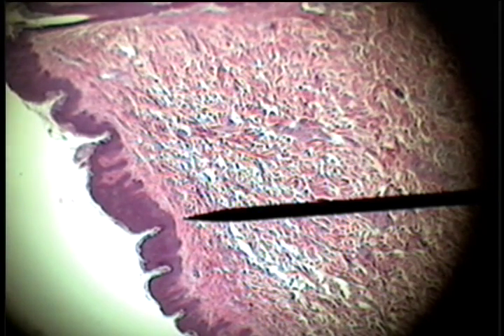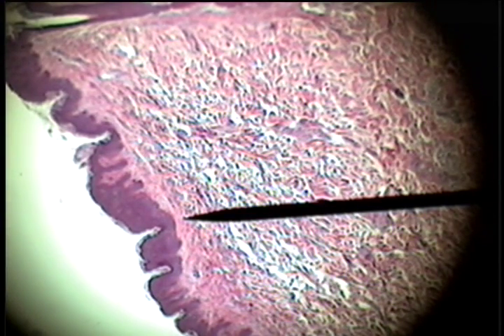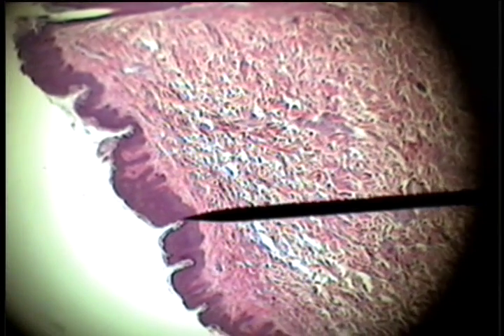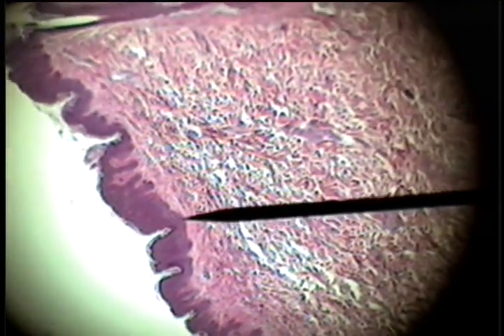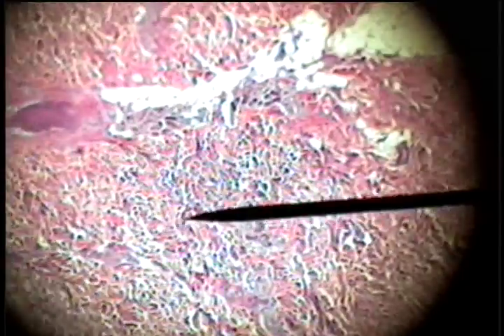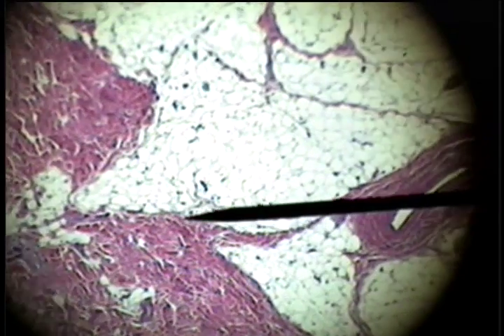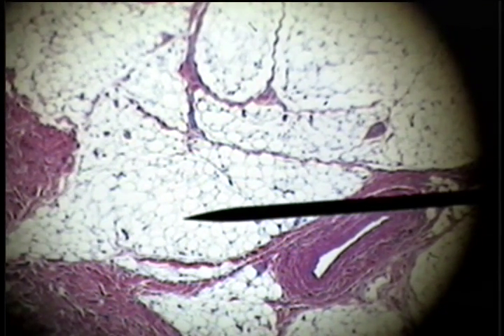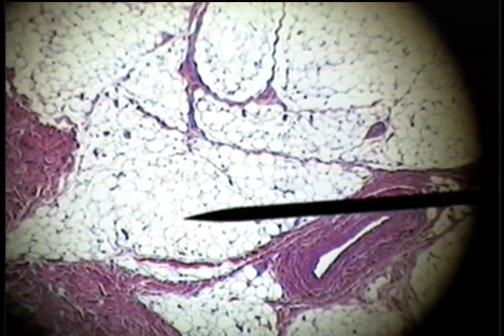Adipose connective tissue is found surrounding many organs of the body and neurovascular bundles. One place that we find it is under the skin. Here's the outer layer of the skin — the epidermis. Here's the dermis, which is dense, irregular, collagenous connective tissue. And then the hypodermis of the skin, which in many cases is composed mostly of adipose.